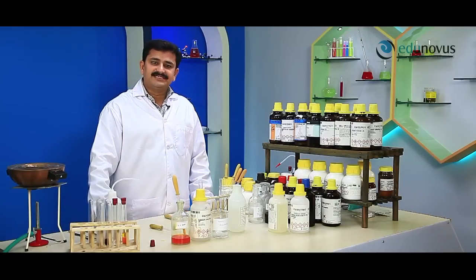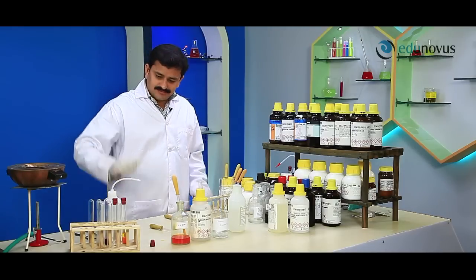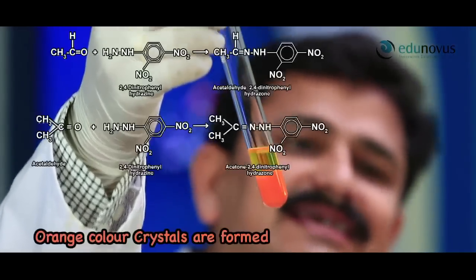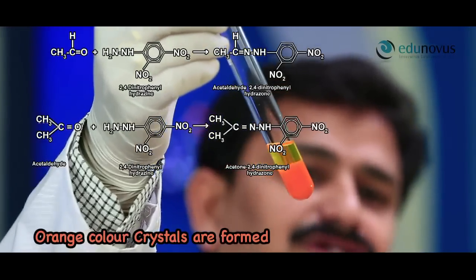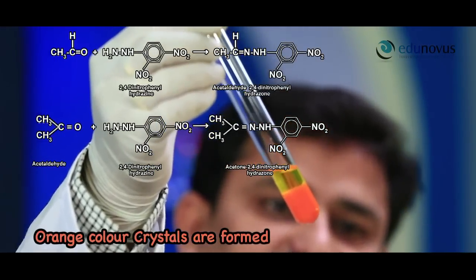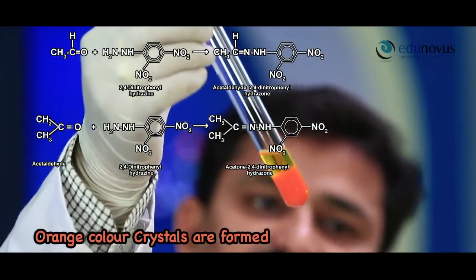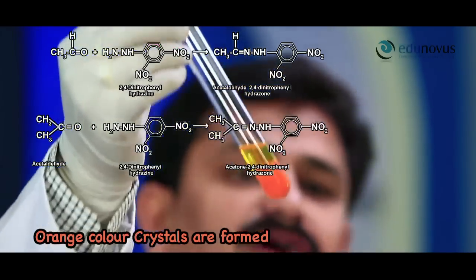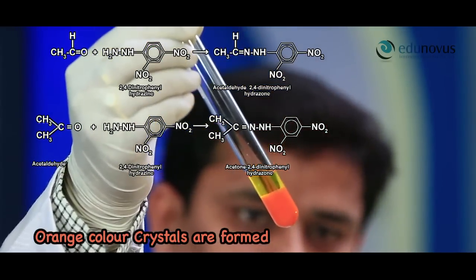After 5 minutes, you can clearly observe the formation of yellow-orange crystals, which indicates the presence of the carbonyl group.